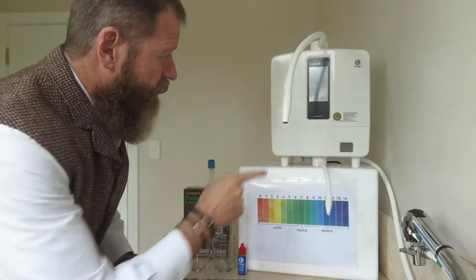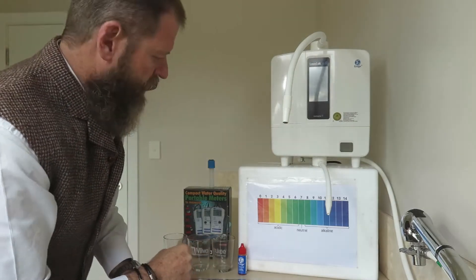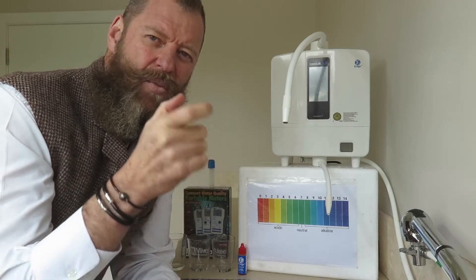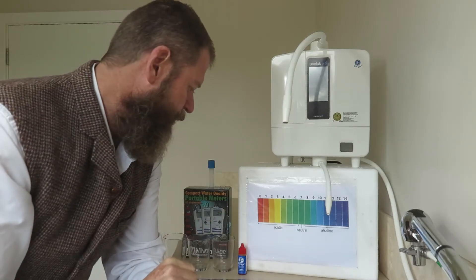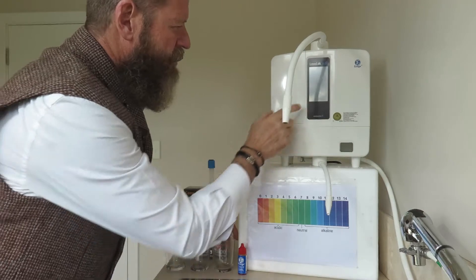What I'm going to be doing now is filling up strong acidic water in one glass and alkaline water in the other. I'm going to be dipping the probe into the two to steady the numbers in between, and once I've calibrated the machine then I can take my water reading. I'm going to start by switching my machine on.